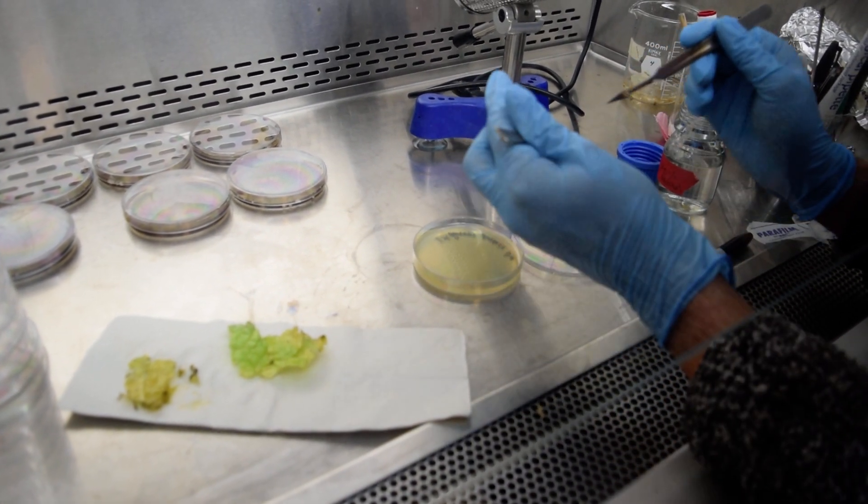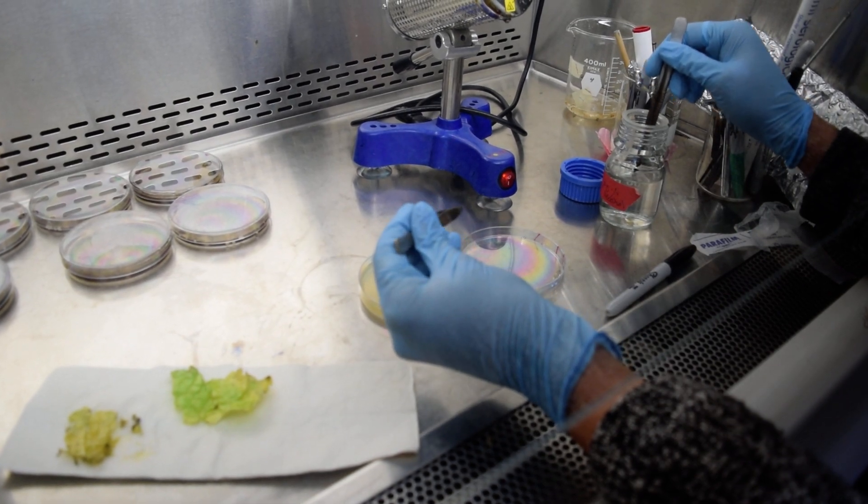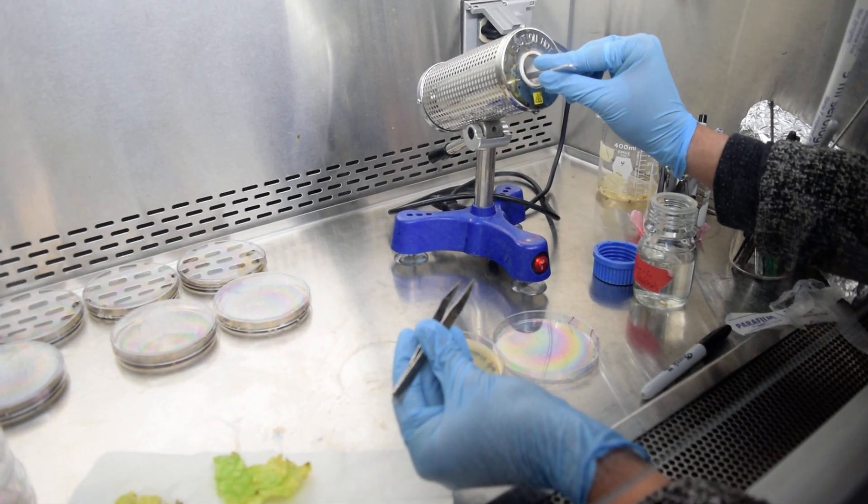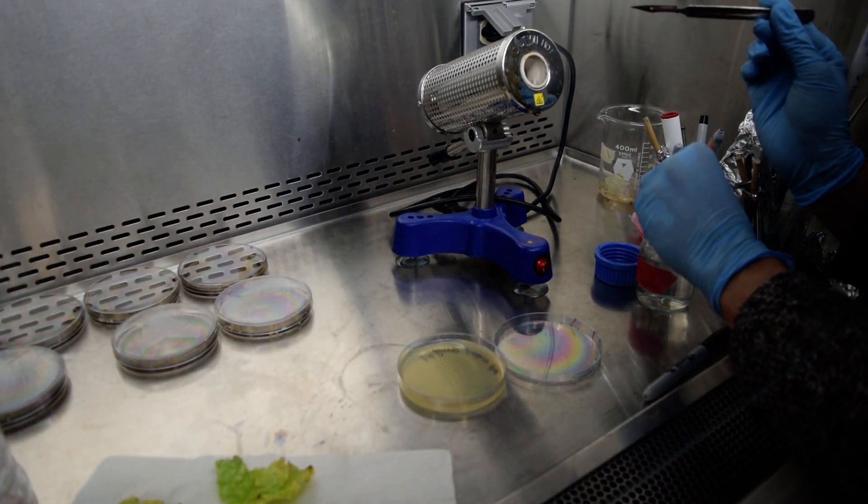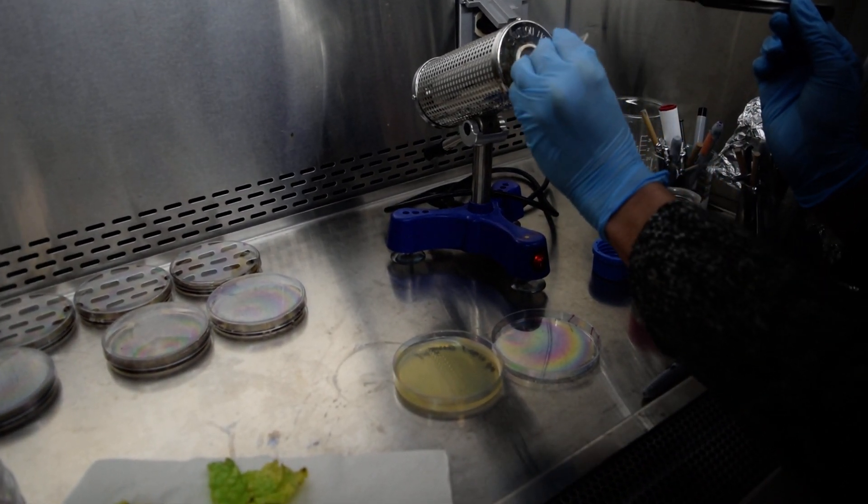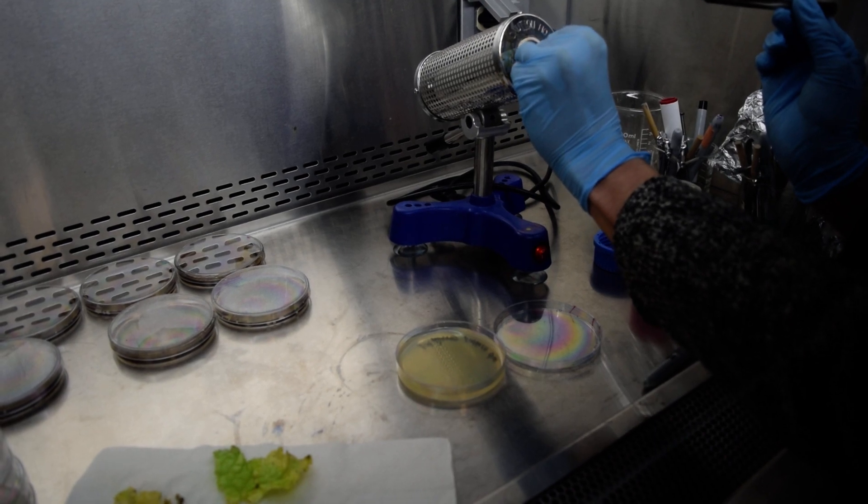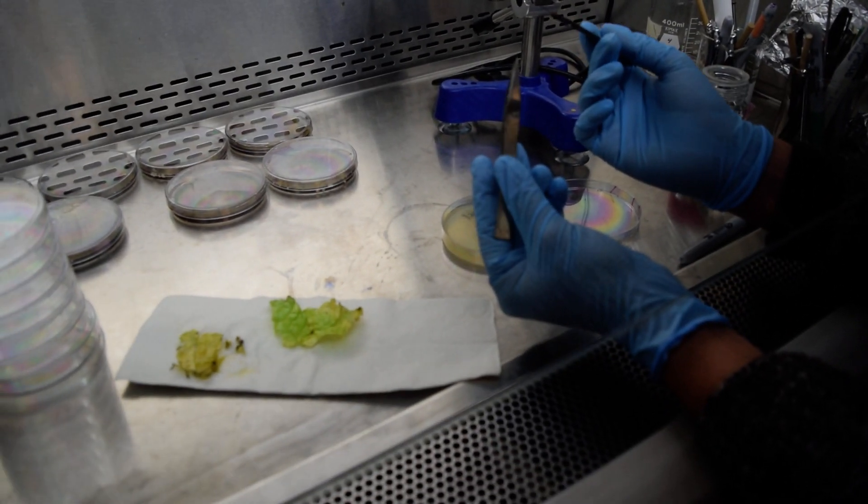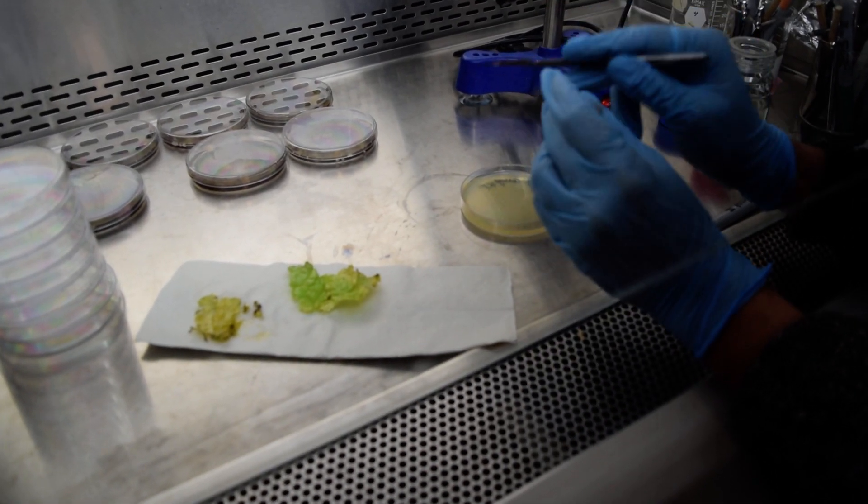We first sterilize the knife and tweezers by dipping them into the alcohol and heating them in the incinerator. The same process for the tweezers too. We allow some time for cooling.